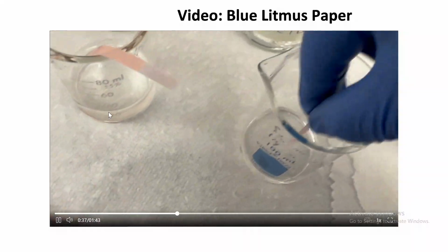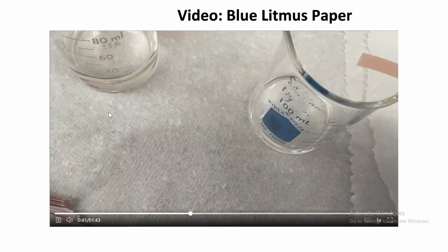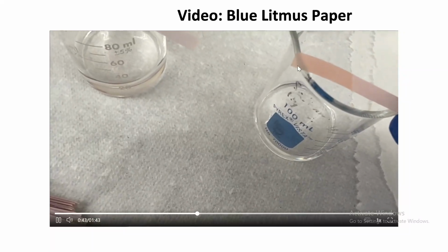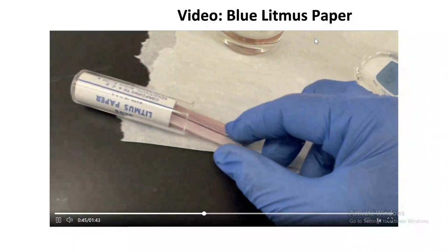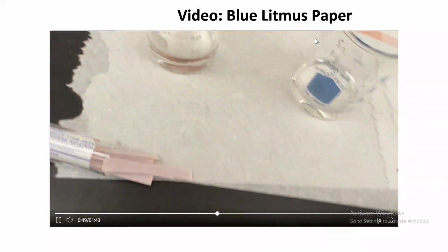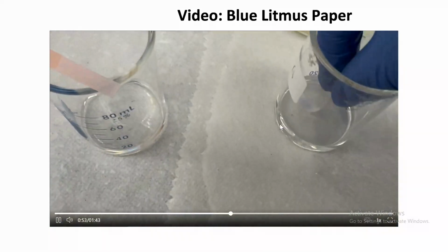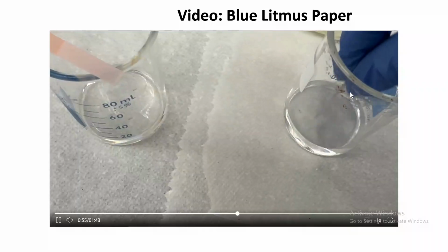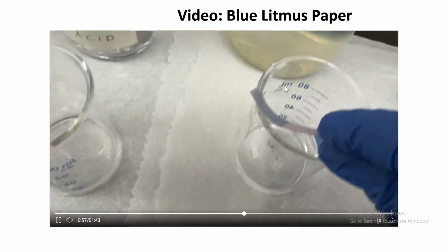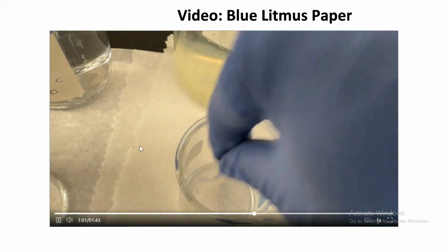We're dipping blue. That's the second solution. Notice what happened to the color. Third solution, blue litmus. Oh, look at that. Very blue. Very blue.